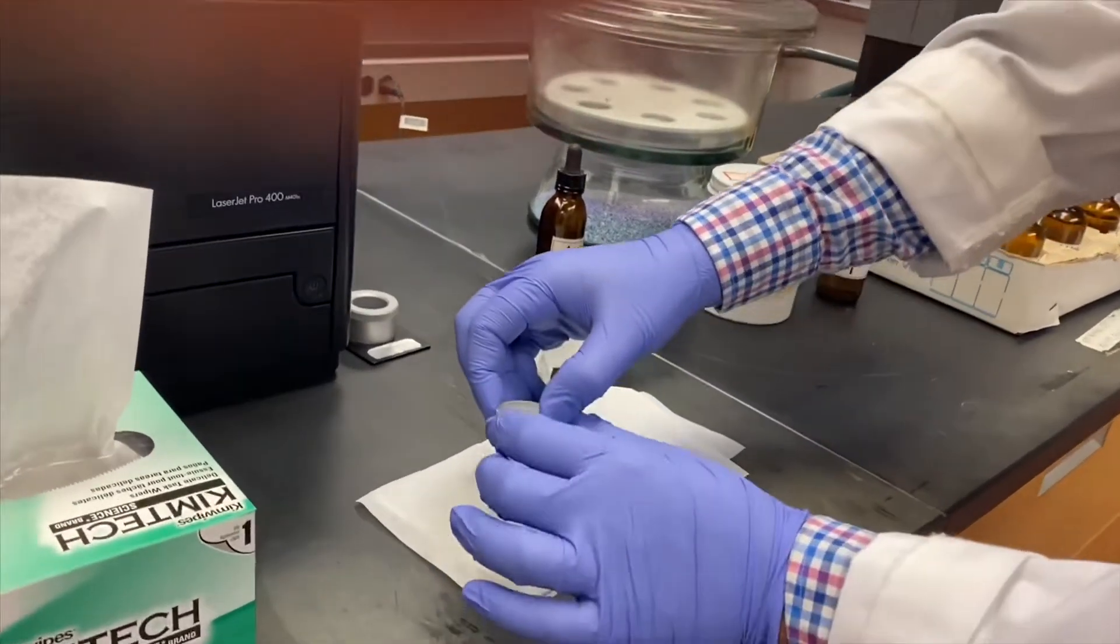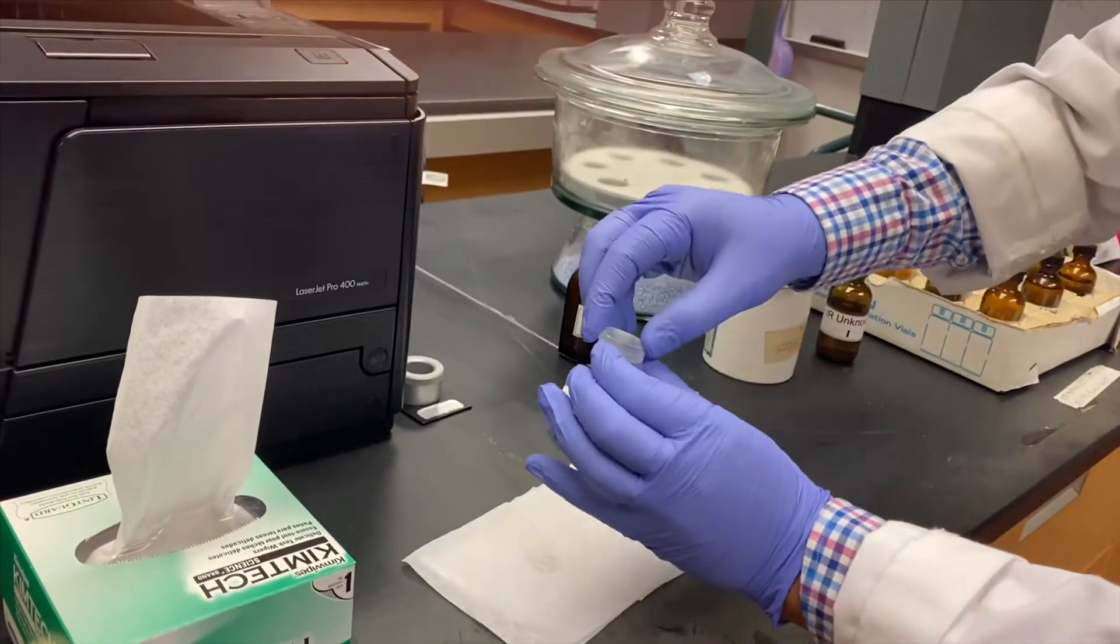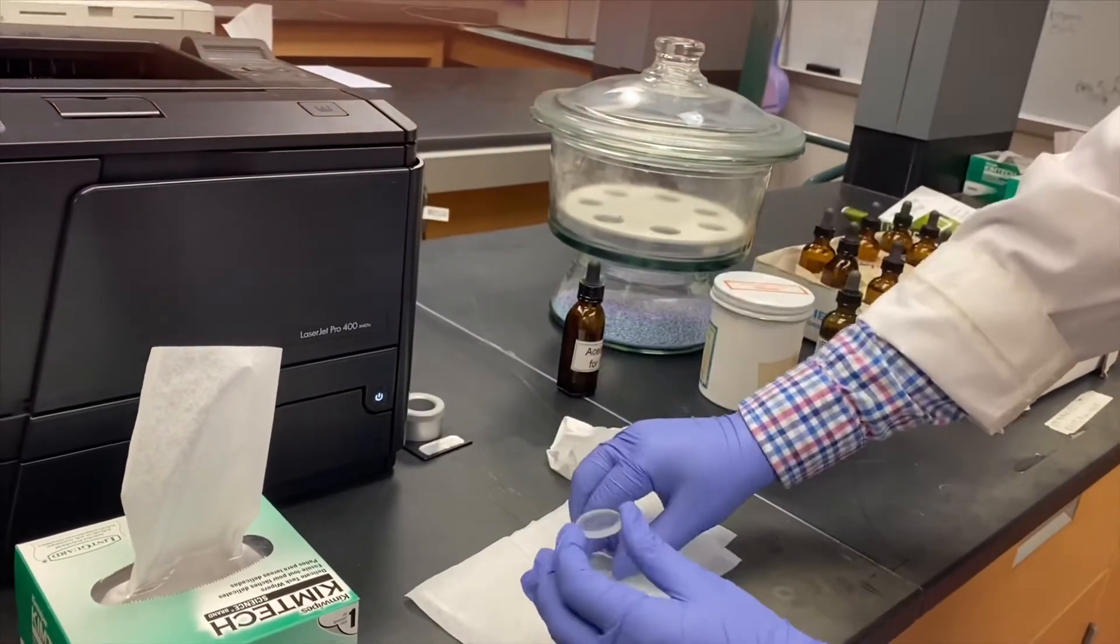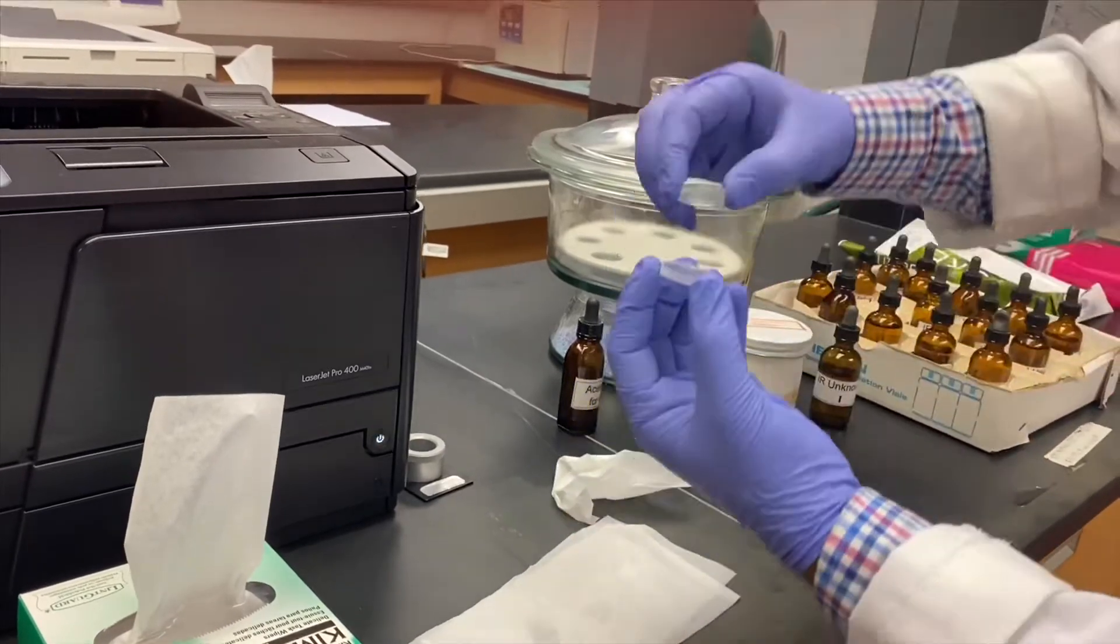If you think the solution is very concentrated, you can wipe one of the plates with kim wipe.